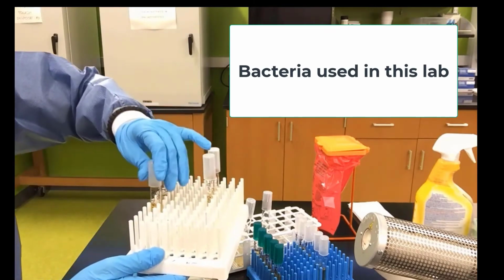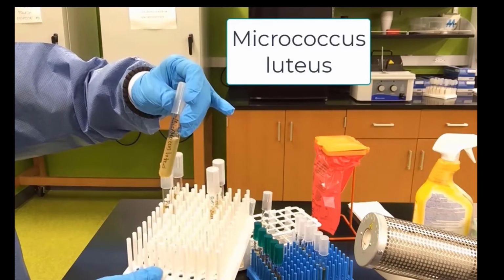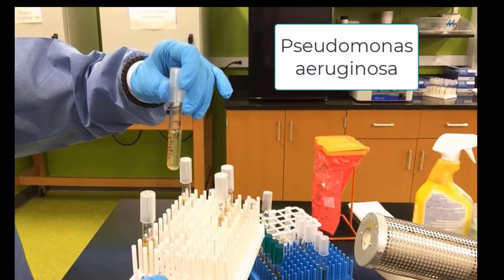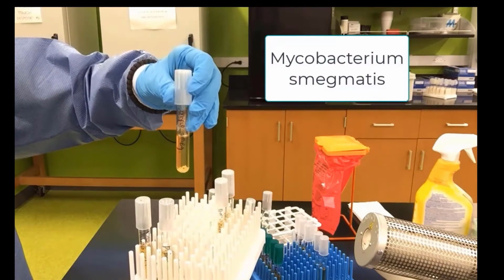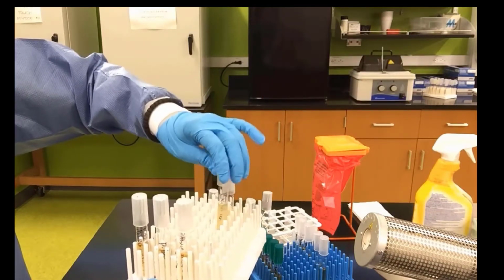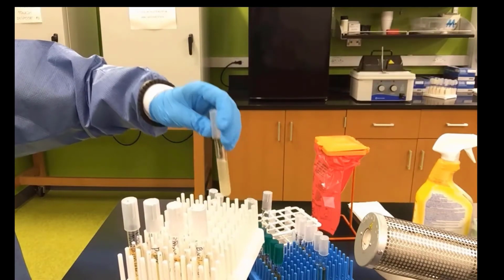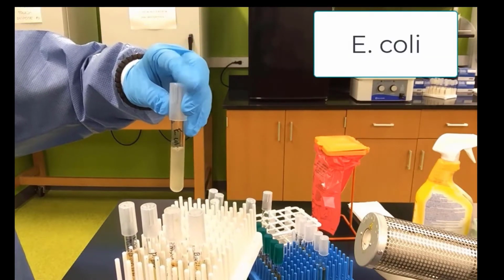The bacteria used in this lab are the following: Micrococcus luteus, growing in a liquid medium. Pseudomonas aeruginosa, also growing on a liquid medium. Mycobacterium smegmatis, in liquid. Bacillus cereus, in liquid. And notice all of these are labeled from our lab staff. And E. coli, the last bacterium, also in liquid.